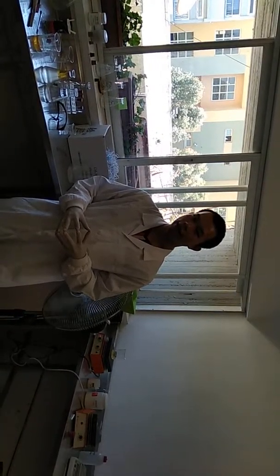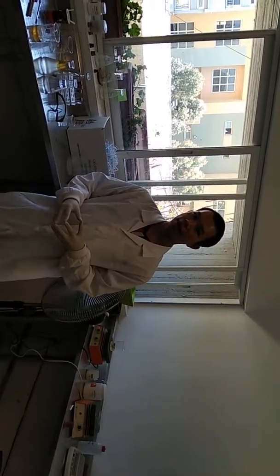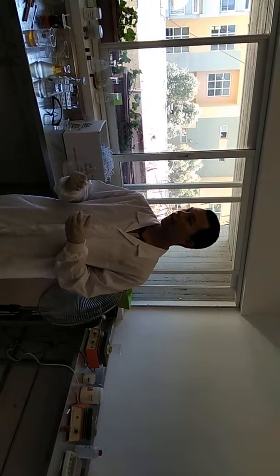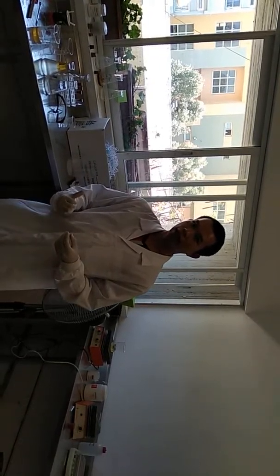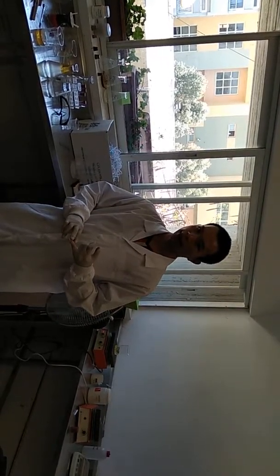study essay, which has a topic about analyzing the impact of catalytic acids. In this case, I use sulfuric acid. How does sulfuric acid impact the esterification process? And that's what I'm going to do.